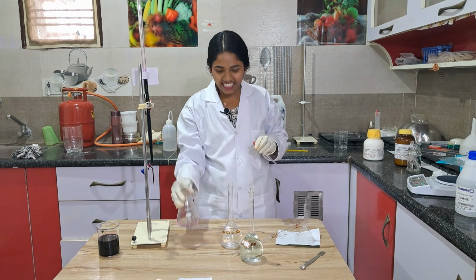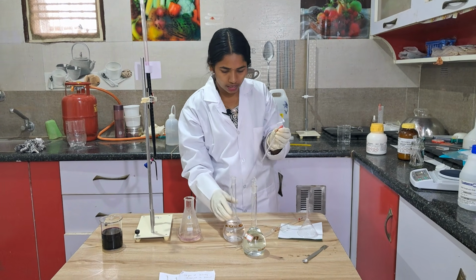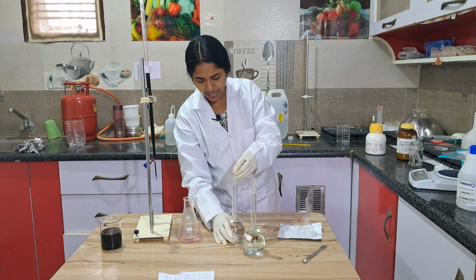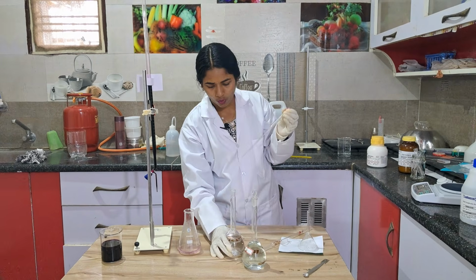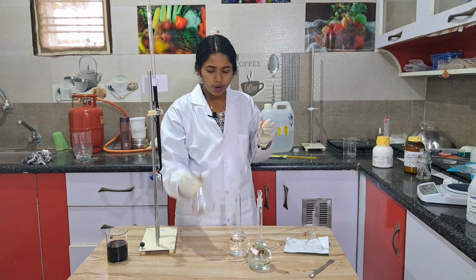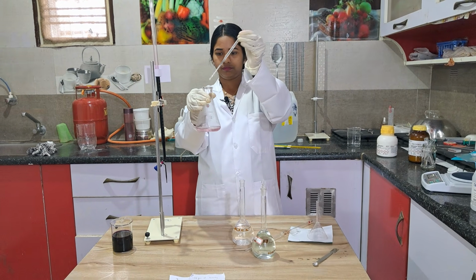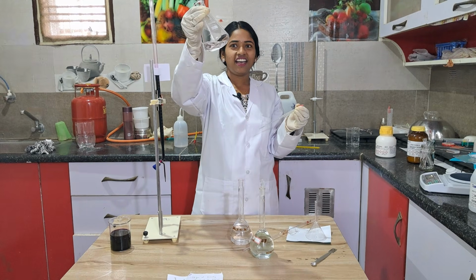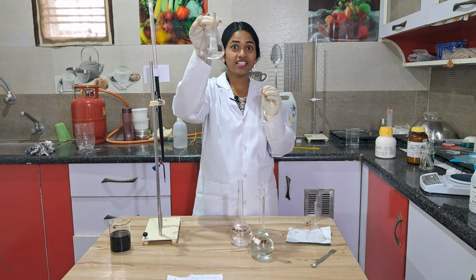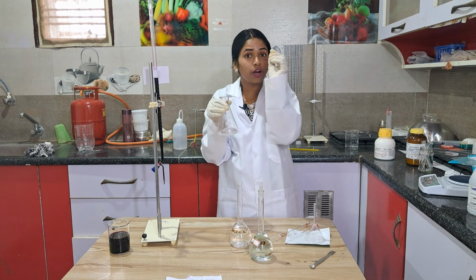The easiest technique is what I do, or your teacher can do: take one drop of this, only one drop of oxalic acid, put it in this KMnO4. See? Exactly disappeared, right? So this is perfect titration. Means I got that endpoint with a single drop.